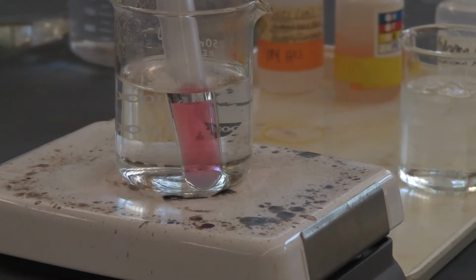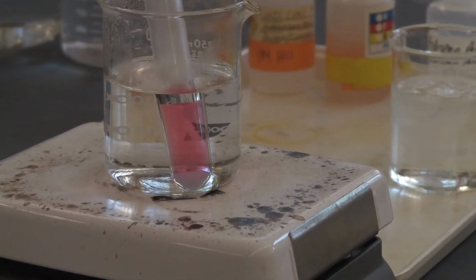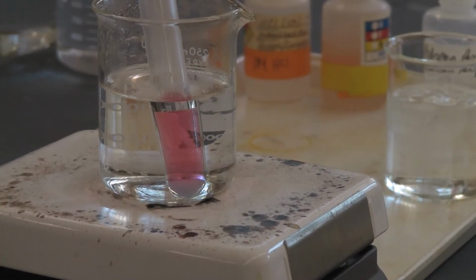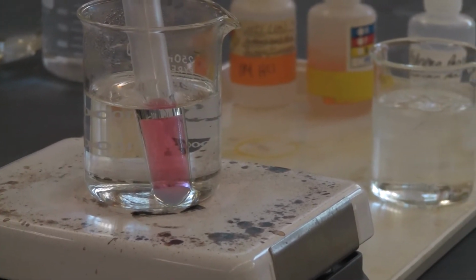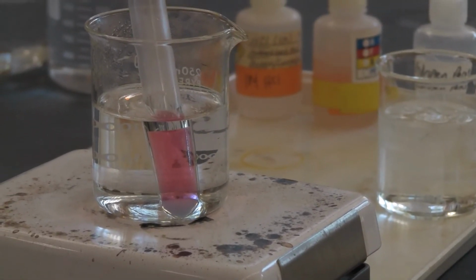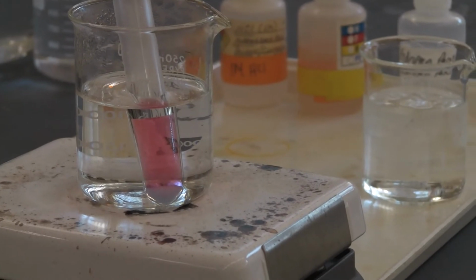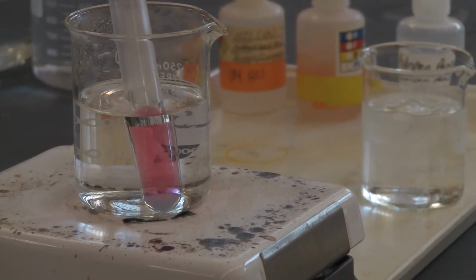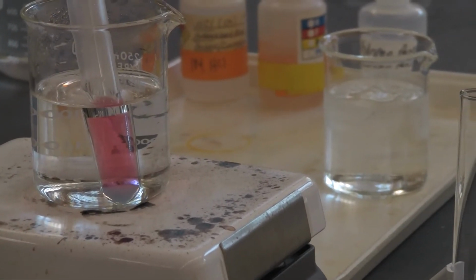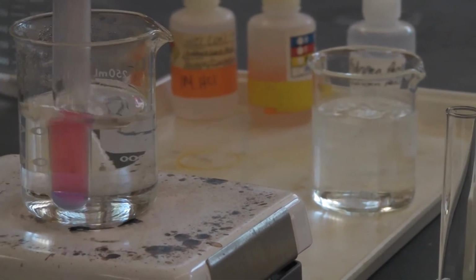So at different spots of the equilibrium, when you increase or decrease the temperature, they're going to shift the equilibrium in different directions. So you are going to look at the color change to figure out, if I heat it, where the equilibrium shifts.